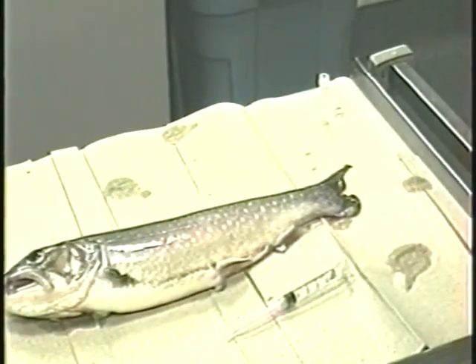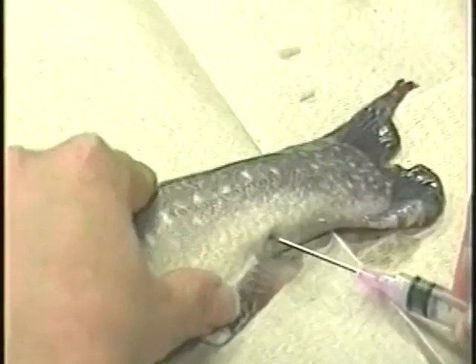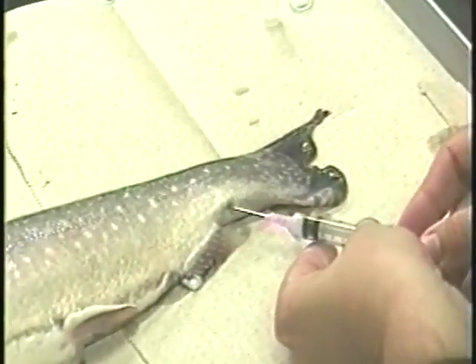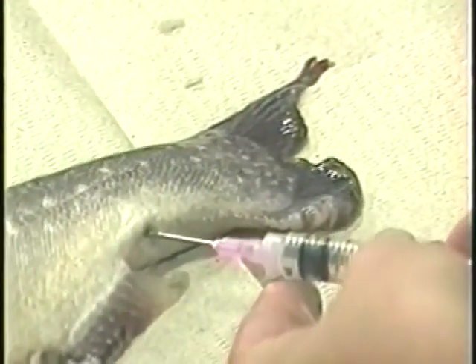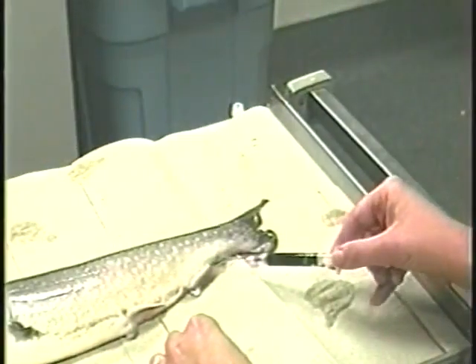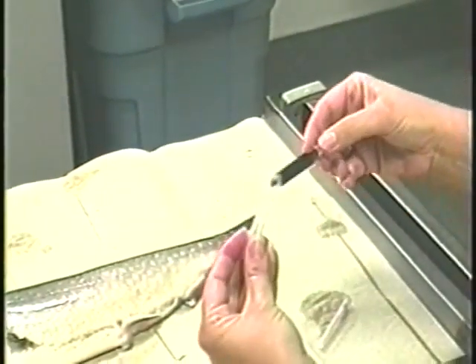Larger amounts of blood can be collected by several methods, but puncture of the dorsal aorta is perhaps the easiest, and the fish does not have to be killed for this procedure. Use an 18-gauge needle for large fish, a 21-gauge needle for small fish, and a syringe that has been rinsed with heparin. Insert the needle at the midline between the anal fin and the caudal peduncle until you feel the backbone. Apply slight back pressure and move the needle slightly until the blood begins to flow. When an adequate sample is collected, withdraw the syringe, remove the needle, and expel the blood into a tube that can be spun in a centrifuge.